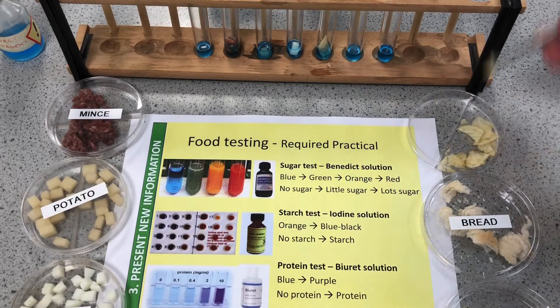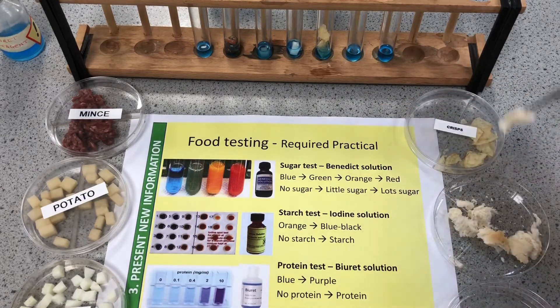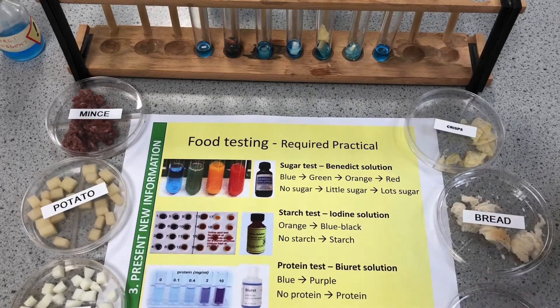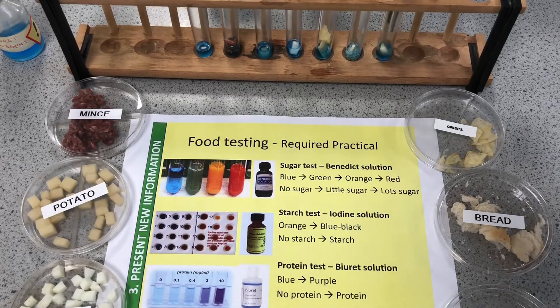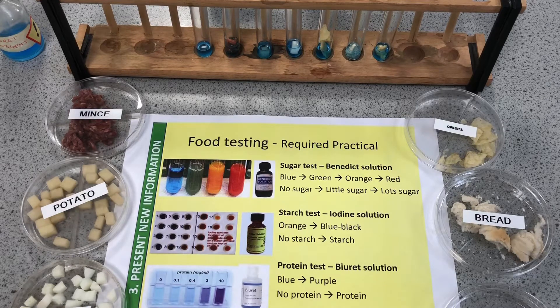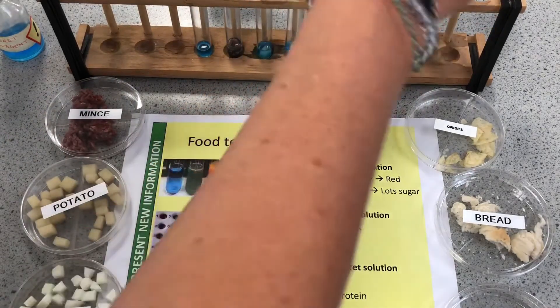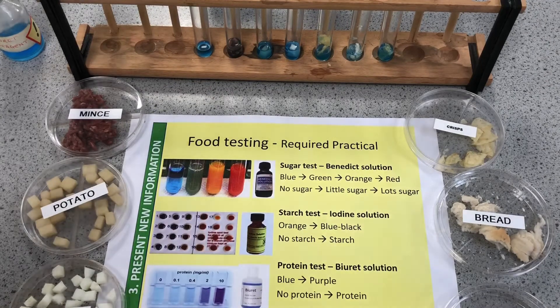Adding food to the tubes: potato, egg, crisp, bread, and biscuit. We're looking for that purple color for protein. You can crush the food because it gives a larger surface area and may give a slightly more obvious change in results. We'll leave those for a bit and come back to see the results of both the Benedict's test and the biuret test.